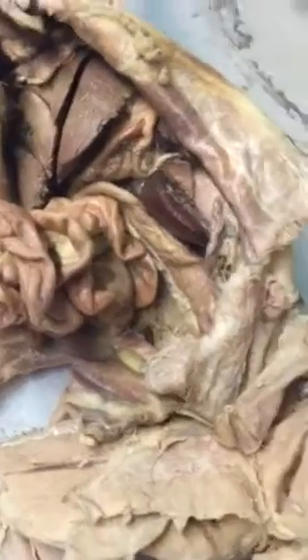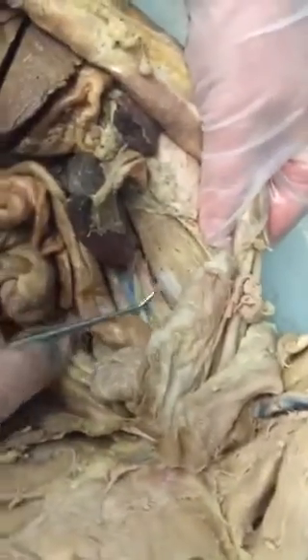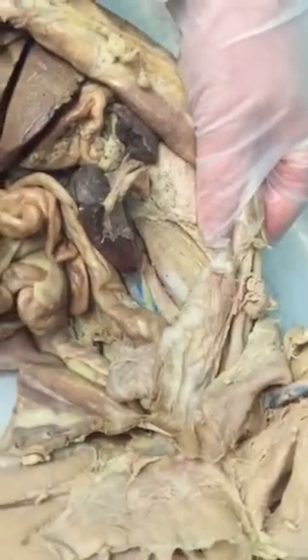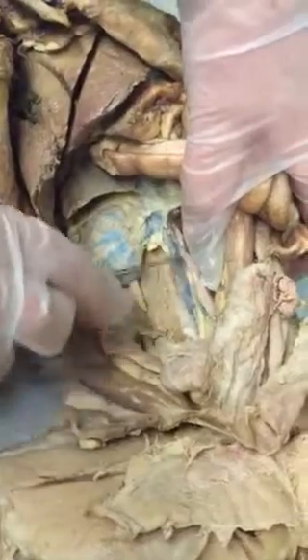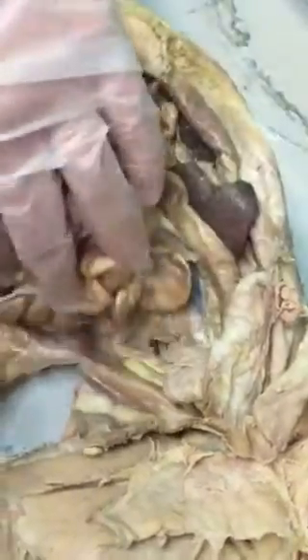Great. Let's do the thigh, and then we're finished. So this is the iliopsoas. It's the muscle on the back wall of the abdomen. It's the only muscle in the abdominal cavity. So if I ask you for a muscle in the abdominal cavity, it has to be the iliopsoas. Anything else, I'll say identify the organ. This is the other iliopsoas. There's one on each side of the spine. Remember, most of these muscles are on both sides of the body.